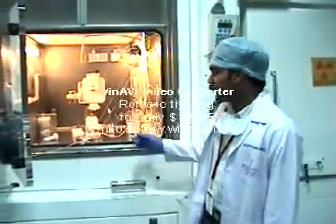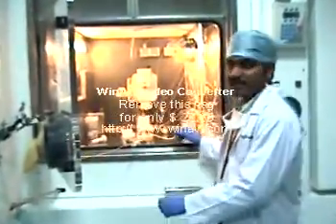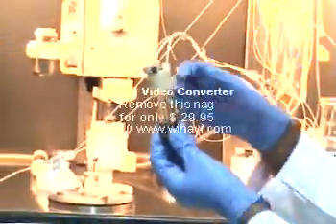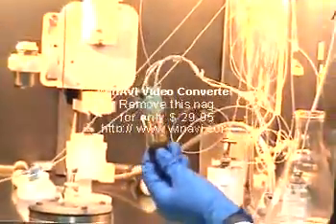Now we see the synthesis process step by step. Once F-18 fluoride is delivered from the cyclotron, it reaches the vial. Once the activity is collected in the vial, we pressurize this vial so that the activity gets transferred to the chemistry module.